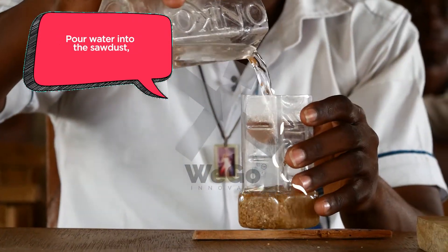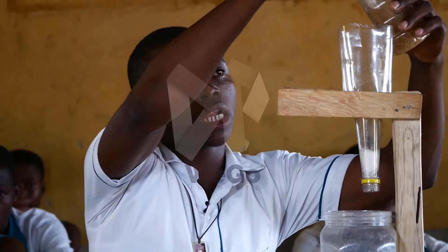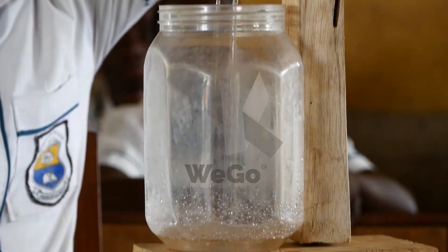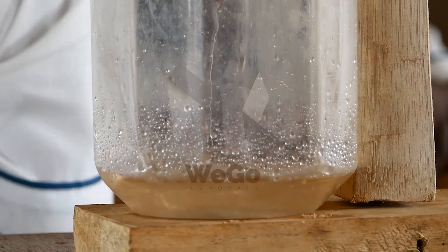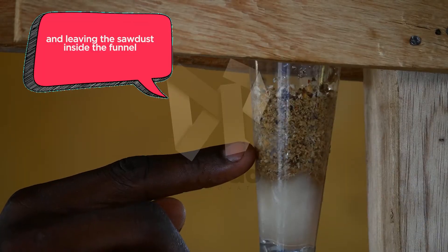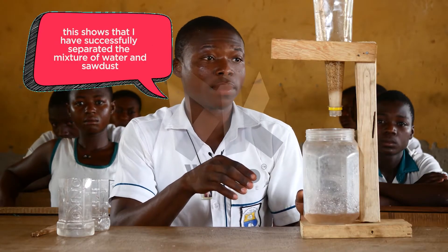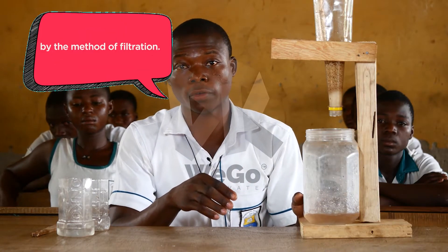Pour the water into the sawdust. Use the stirring rod to stir it. Gently pour the mixture into the funnel. As you can see, the water drains into the container, leaving the sawdust inside the funnel.